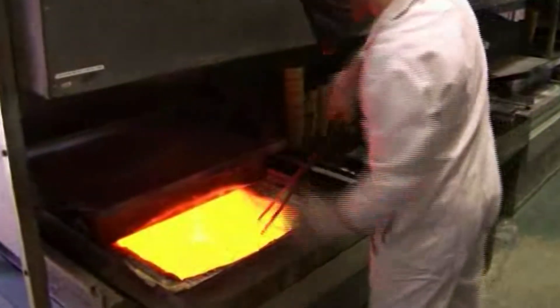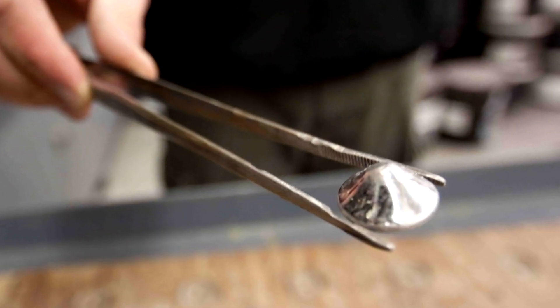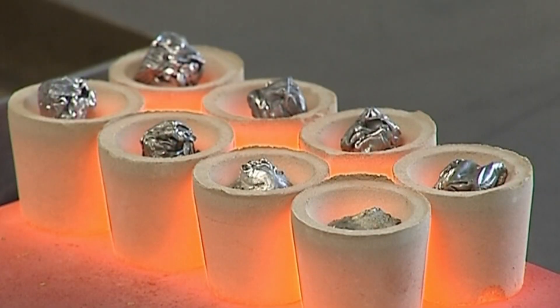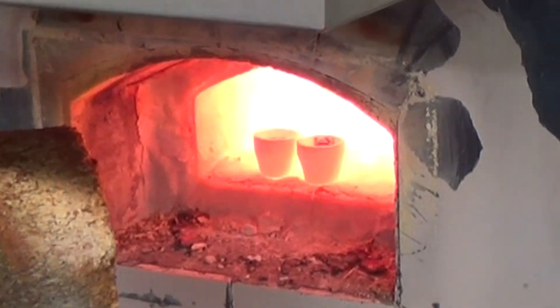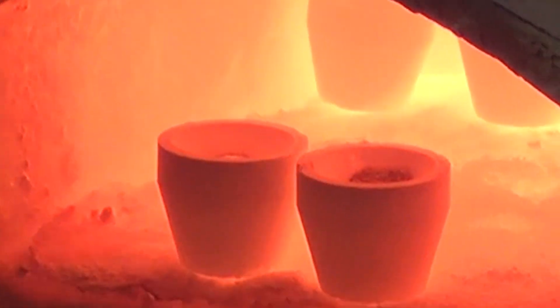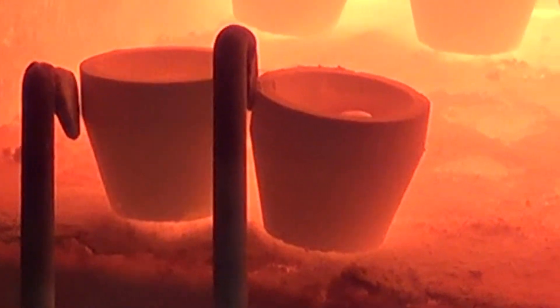Once the reaction is complete, the contents are poured into a mold or breakable crucible, allowed to cool, then the metal alloy is removed from the slag. The lead served to collect the precious metals. Metallic samples can be processed by fire assay using lead rather than lead oxide; the samples are wrapped in lead foil to provide the lead collector. Silver is sometimes also added to help completely dissolve the sample into the lead alloy for cupellation. Platinum group metals are much more difficult to analyze using fire assay. Other metals or metal compounds such as copper or nickel sulfide are sometimes added as collectors when platinum group metals are present.